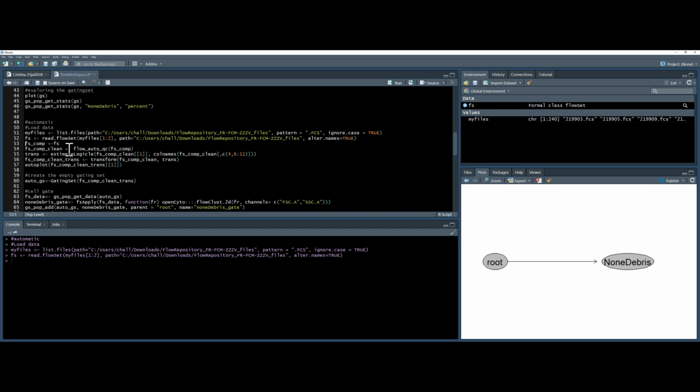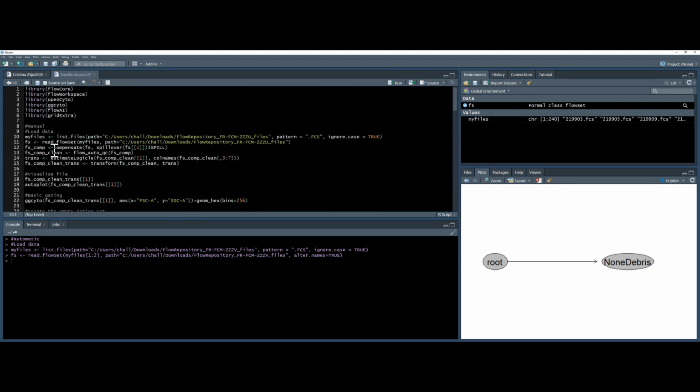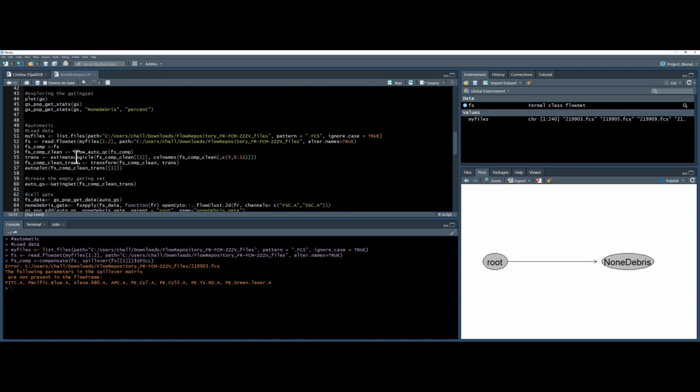Okay, so again, we will compensate and clean the file. If memory serves me right, the compensation doesn't work very well for this one, and I have the wrong command, so I'm just going to copy. I'll just use this one here because it's the same, and it's going to give me an error. This error is caused by something. Let's find out what the error is caused by. Let's look at the data. Flow set. I'll just type in fs down here. Flow set. I can see that this is the name of my parameters, but this is the name in the compensation file, and you can see they're different. How an FCS file has a different compensation matrix to the names of the parameters, I have no idea how that's happened. So to fix that, we need to change the matrix.